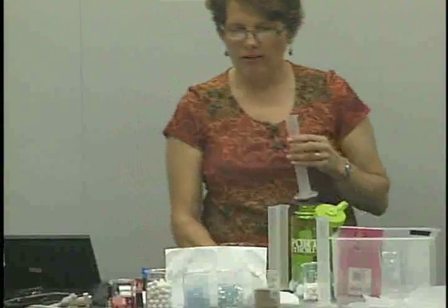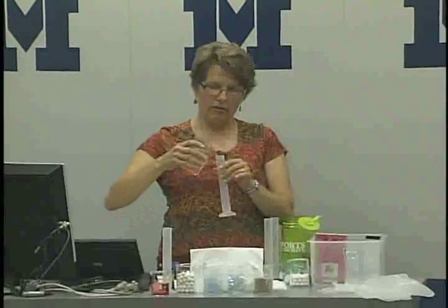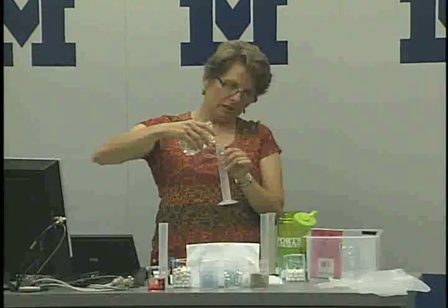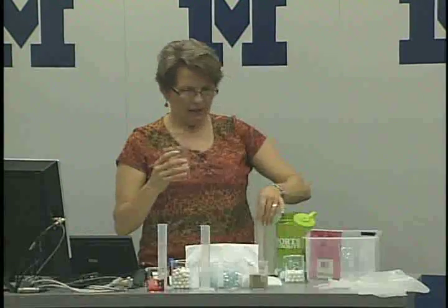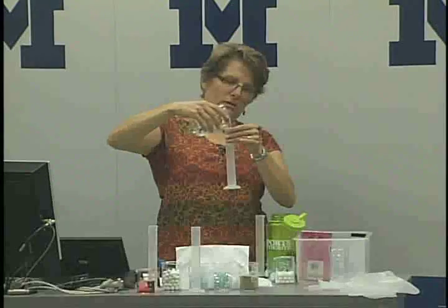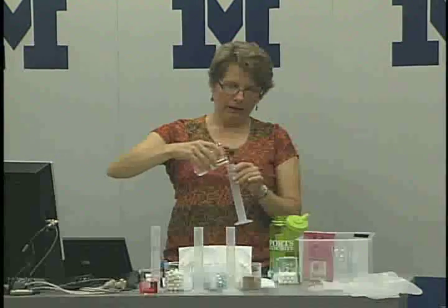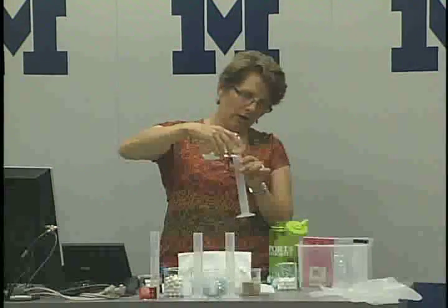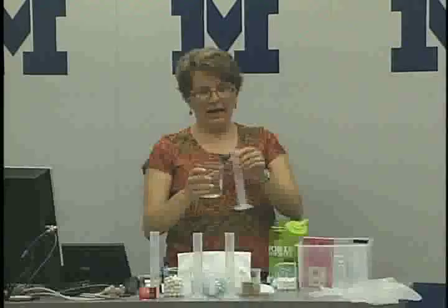And now we're going to pour 50 mils of water into each of 4 graduated cylinders. Each of the cylinders is going to be associated with one of the beakers. We're just pouring in, again, room temperature tap water, into each one. Now remember, in your book there's just 2, but we all discussed this morning, and we thought it would be much better if we compared round to round and flat to flat.